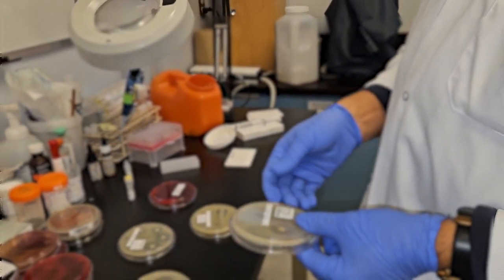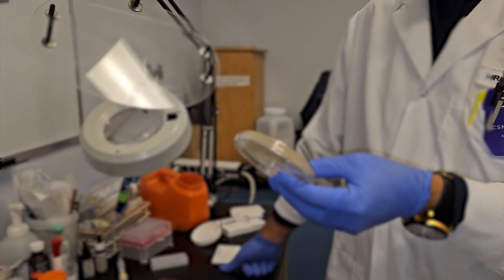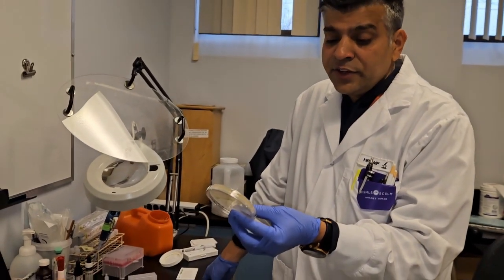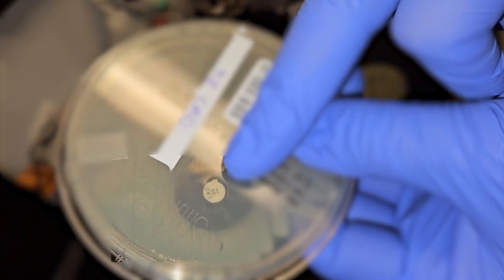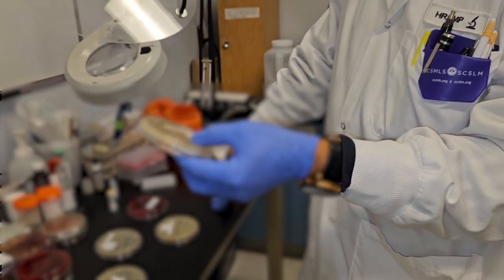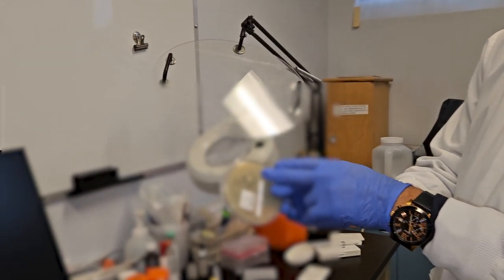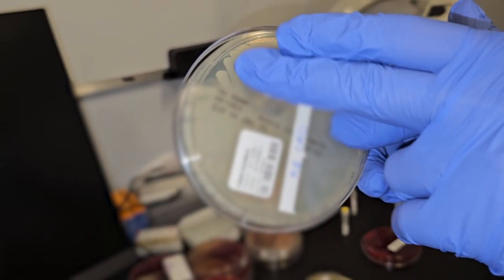What is happening in here is we have to make the inoculum, we call carpet culture or lawn culture. The suspension, 0.5 McFarland, will be evenly spread on the agar using a sterile swab on day 1, and then we have to apply the specific antibiotics you are testing on the agar. You can see one of them in there, which is the ceftriaxone antibiotic testing against one of the E. coli bacteria. We incubate this plate again at 37 degrees Celsius for 16 hours. While doing that, the antibiotic will be diffusing away from the agar where it has originally spotted. That's the diffusion of antibiotics.